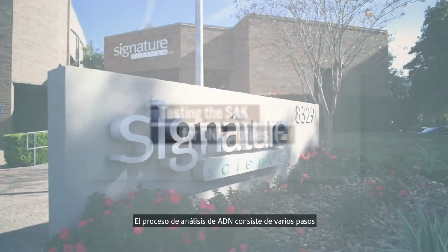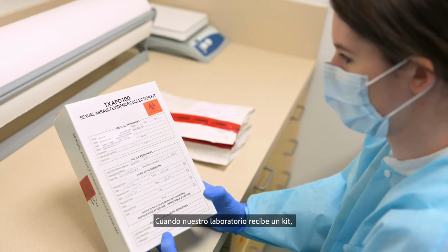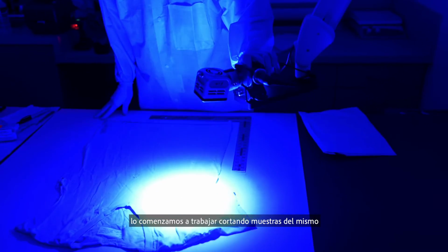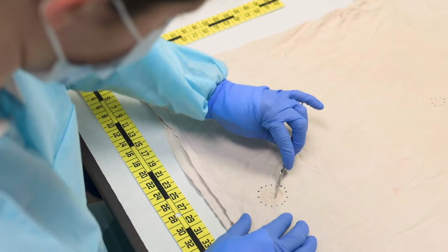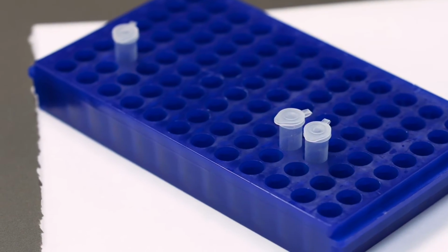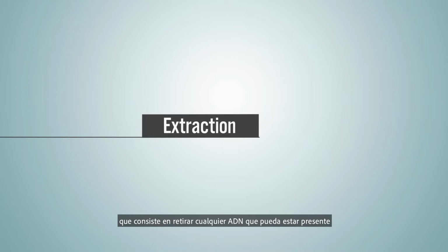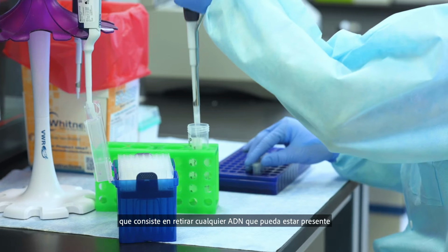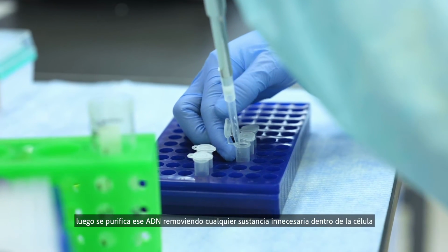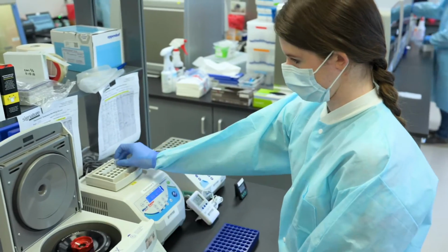The DNA analysis process consists of multiple steps. After a kit would be received here in our laboratory, we would work the kit. That would involve cutting any samples from it, and then those samples would move on to the DNA analysis process. The first step involves extraction, or removing any potential DNA that may be present in that sample from the cells, and then purifying that DNA to remove any other unnecessary items within the cell.